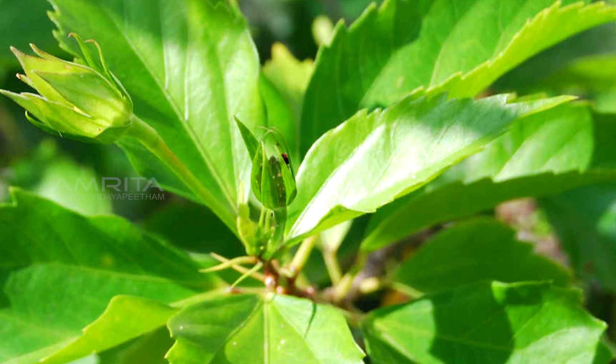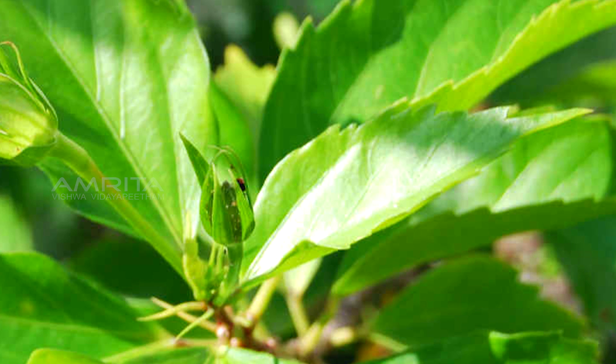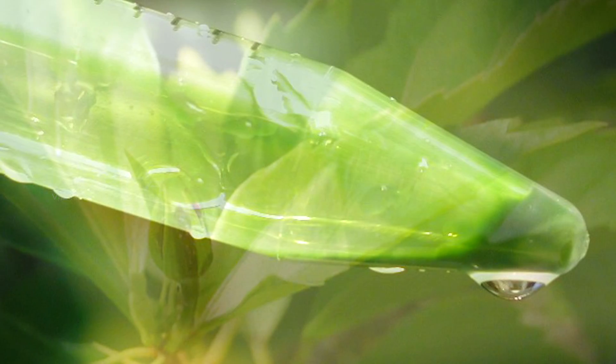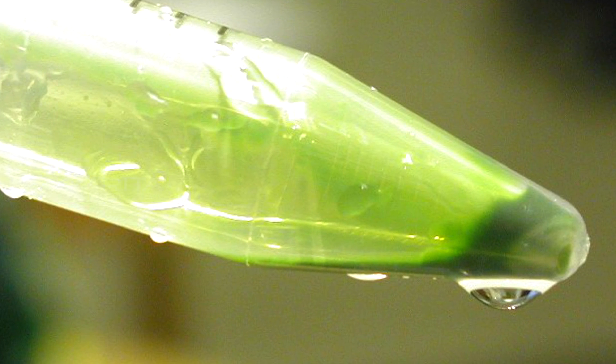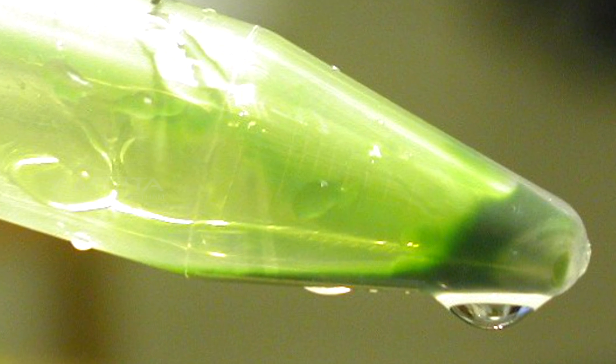In this experiment, the chloroplast is isolated from the green leaves using a simple cell disruption method followed by differential centrifugation.